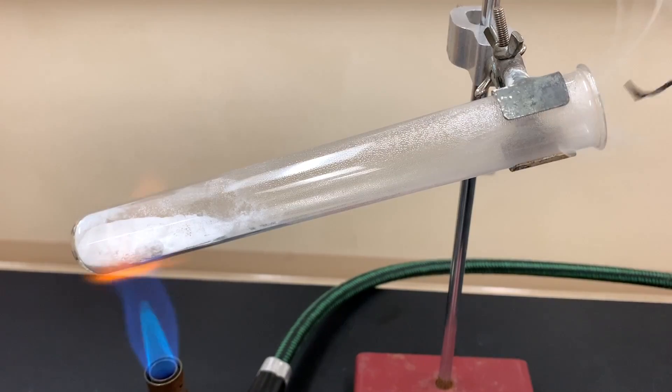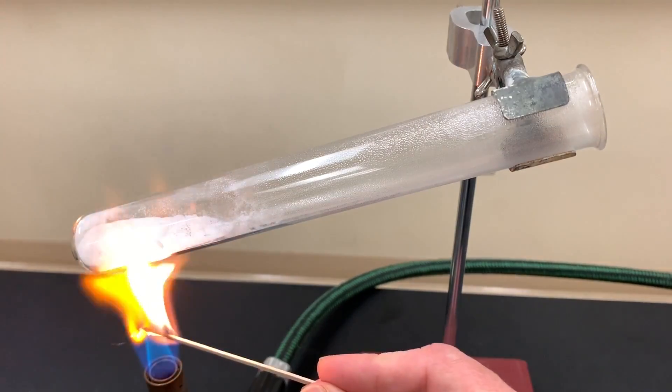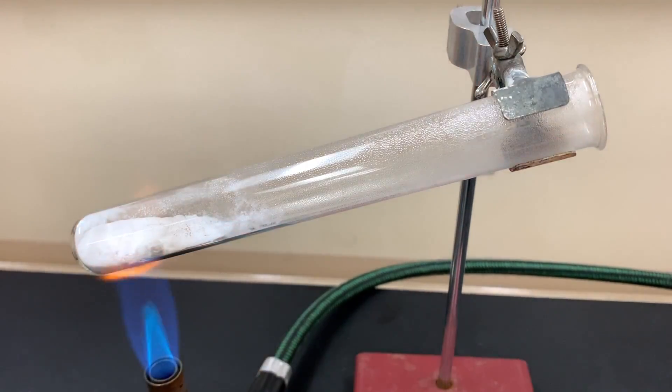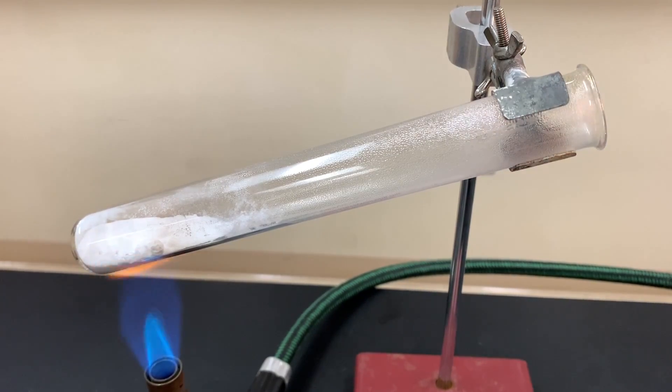To me it looks like there is, extinguish the flame. I'll try it one more time here we go and try not to get any of that burning into the actual test tube as that will increase the mass. So to me that's definitely showing carbon dioxide is possibly present.